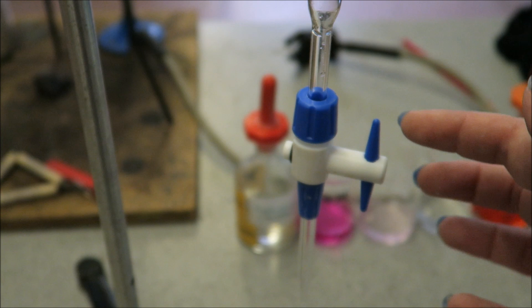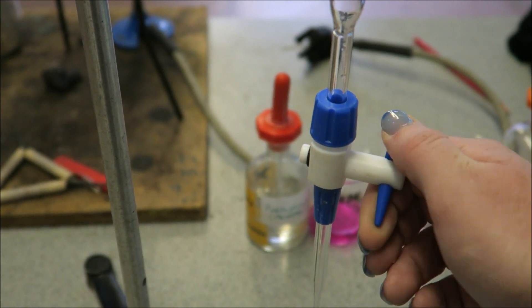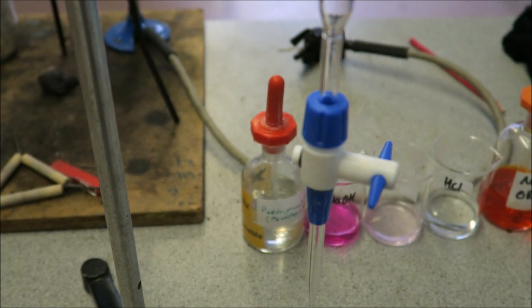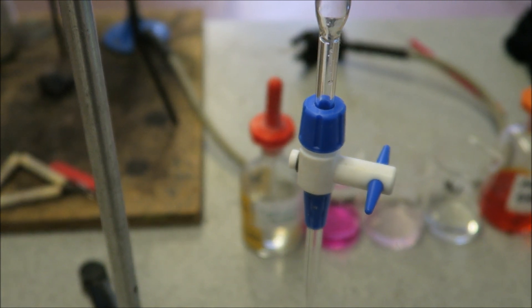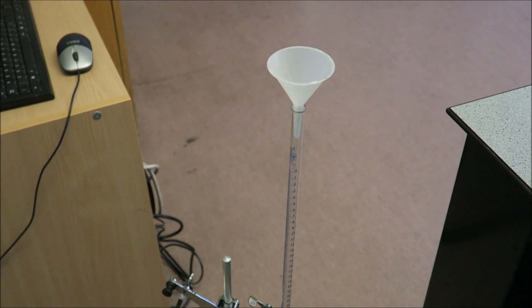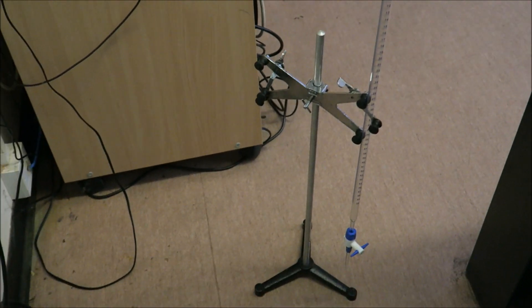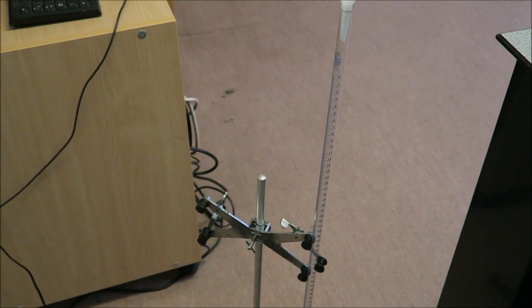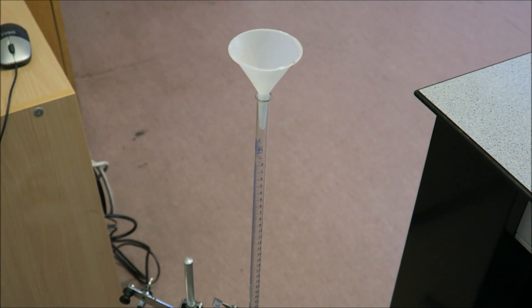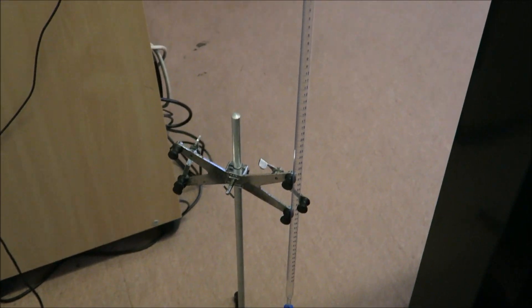Here is the bottom of our burette. You'll notice that this here is in line, which means it's open. When you're filling it, you want to turn it like that so it is closed. If you try and fill it with the tap open, which somebody will do in every single class, it will just fall on the floor. When you are filling a burette, you need to do it below head height. If you try and reach up and fill the burette when it's still on the desk, there's the potential risk of you slipping and pouring it all over yourself or breaking the glass. So put the burette on the floor, put the funnel in the top, make sure the tap's closed down there, and then you can start filling it.